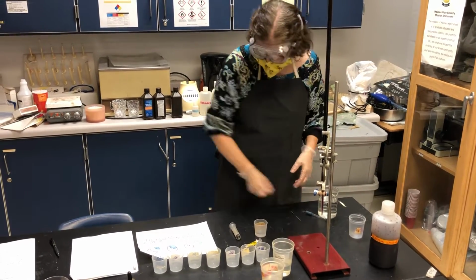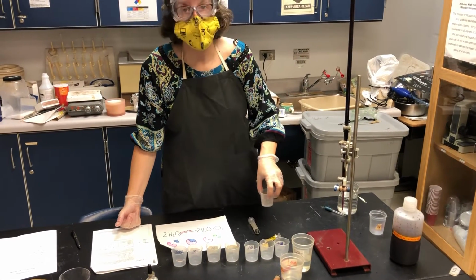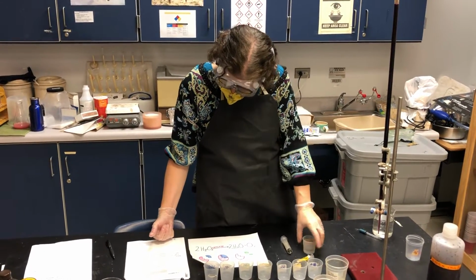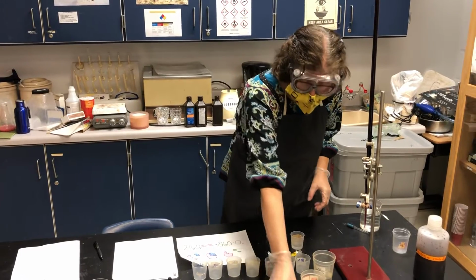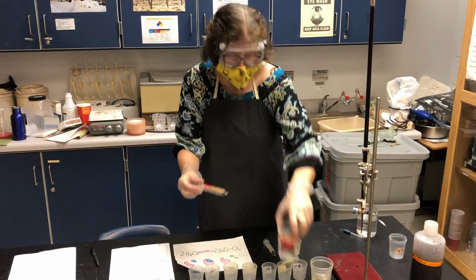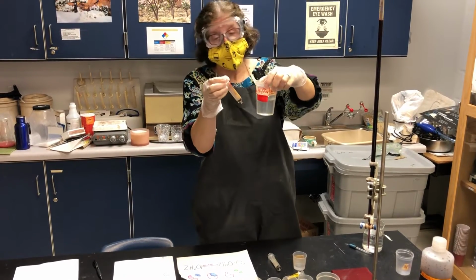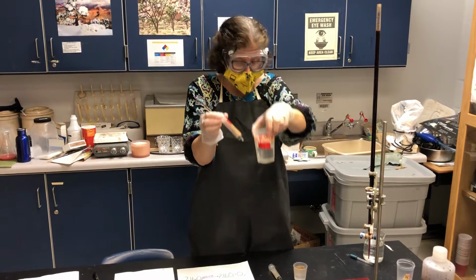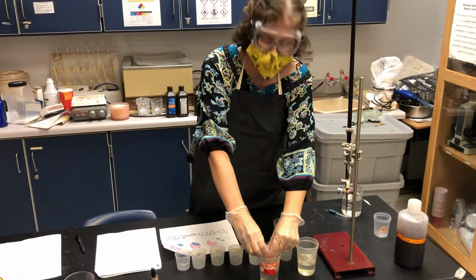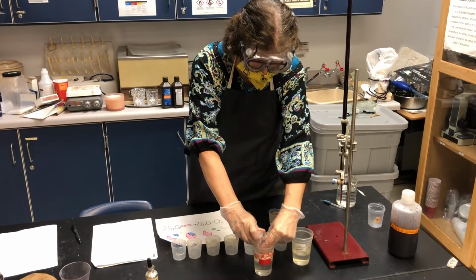So that's my control. I would normally be swirling this and timing the reaction, but since we don't have any real enzyme in there, there is no reaction. So instead, I'm going to now add some sulfuric acid. Now, when there really is enzyme in there, think about what the sulfuric acid will do to the enzyme. This is 1 molar sulfuric acid, so it's not going to hurt me unless I get it on my skin and leave it there for a while, but it will definitely hurt the enzyme. It will cause denaturation of the enzyme.